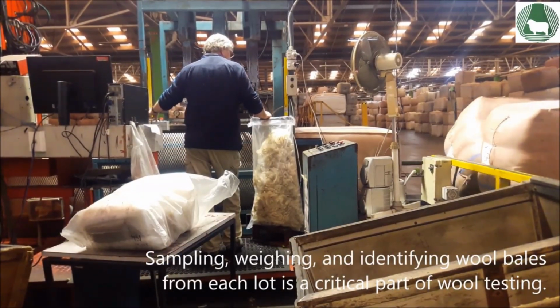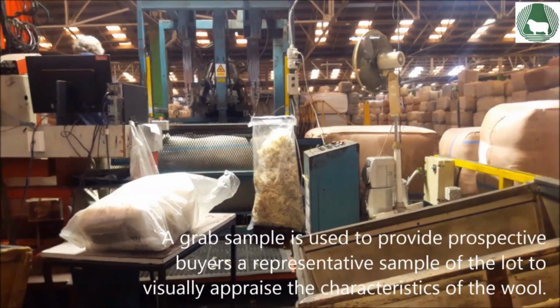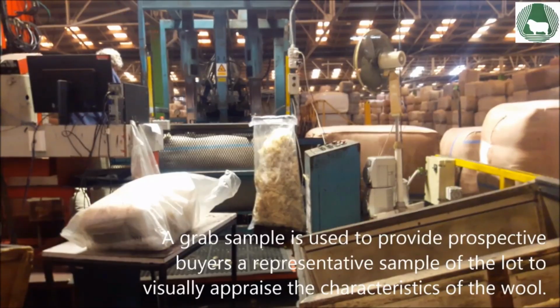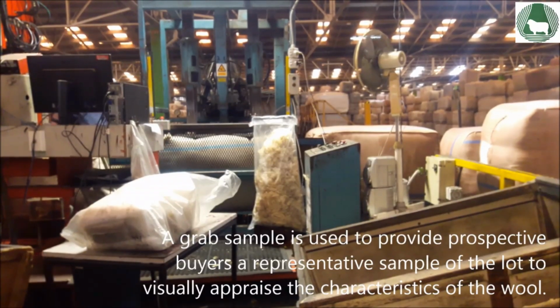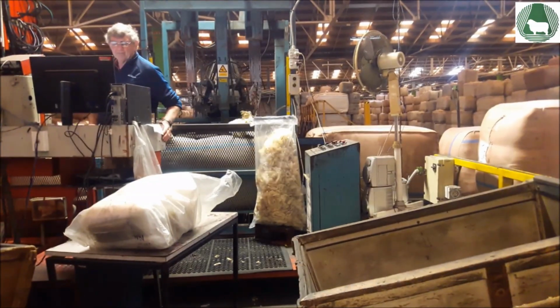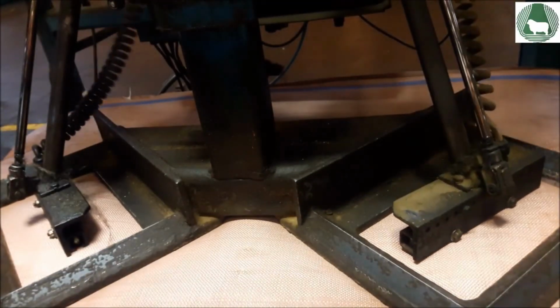Sampling, weighing and identifying wool bales from each lot is a critical part of wool testing. A grab sample is used to provide prospective buyers a representative sample of the lot to visually appraise the characteristics of the wool. It is also the sample that is used for the measurement of staple length and strength of any lot.